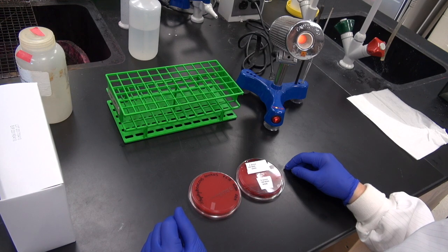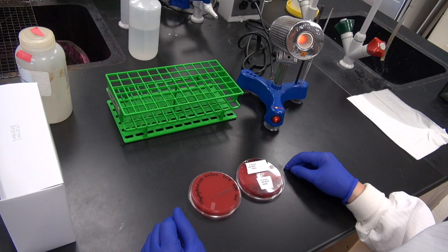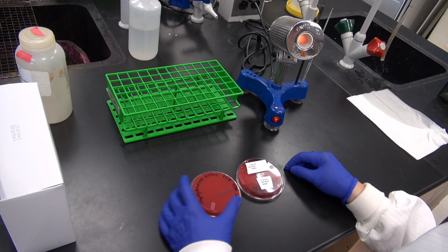We need our culture plate containing already growing colonies of our bacteria, a fresh blood agar plate, an incinerator, and a bacteriological loop.